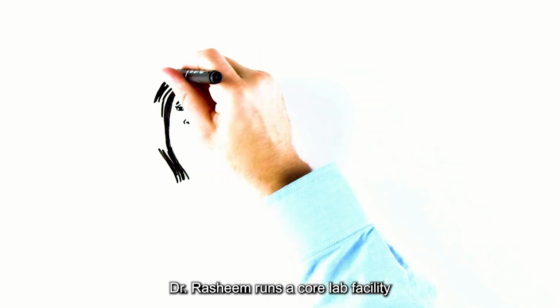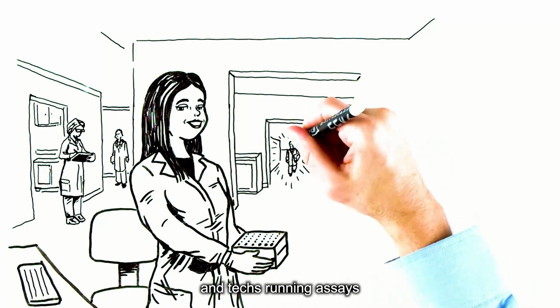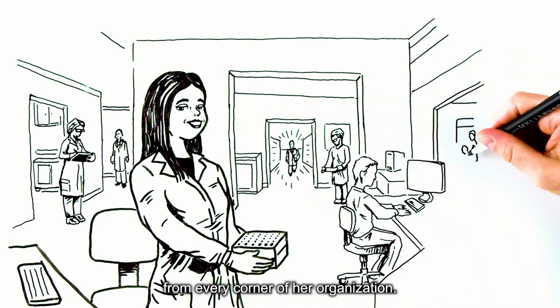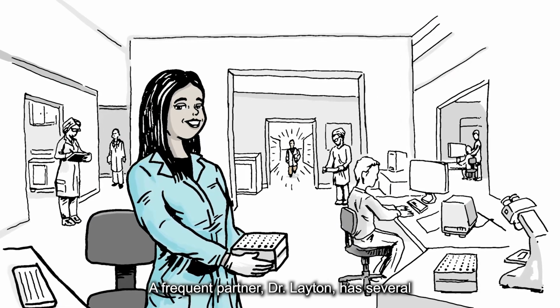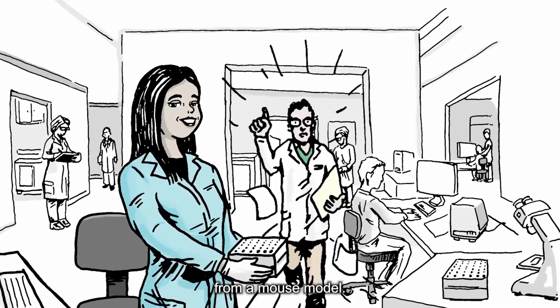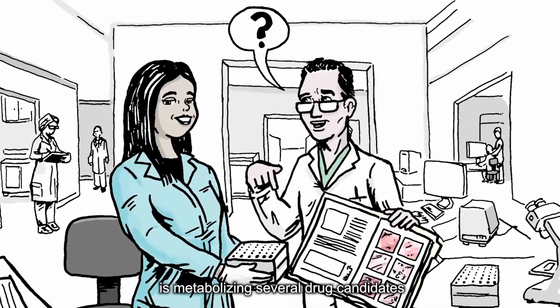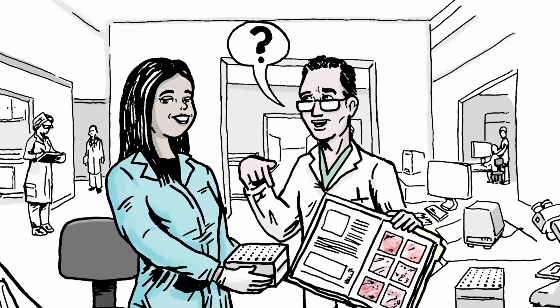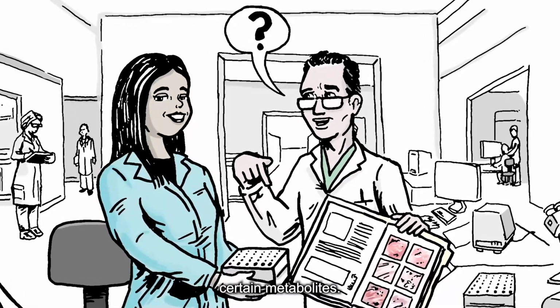Dr. Rashim runs a core lab facility with a staff of scientists and techs running assays for many collaborators from every corner of her organization. A frequent partner, Dr. Layton, has several experimental questions he'd like answered concerning a tissue sample from a mouse model. He needs to know how and where the mouse model is metabolizing several drug candidates, and asks for Dr. Rashim's suggestion on the best way to track certain metabolites.